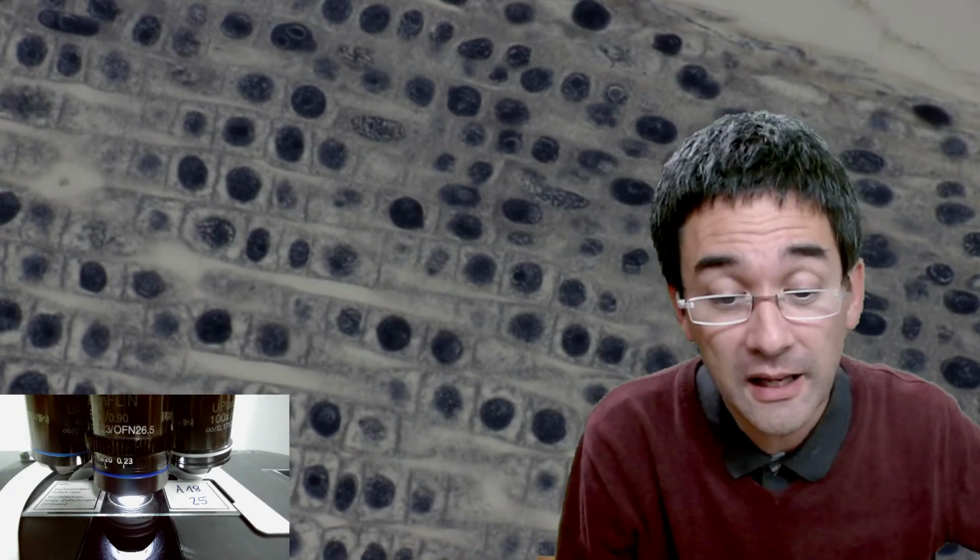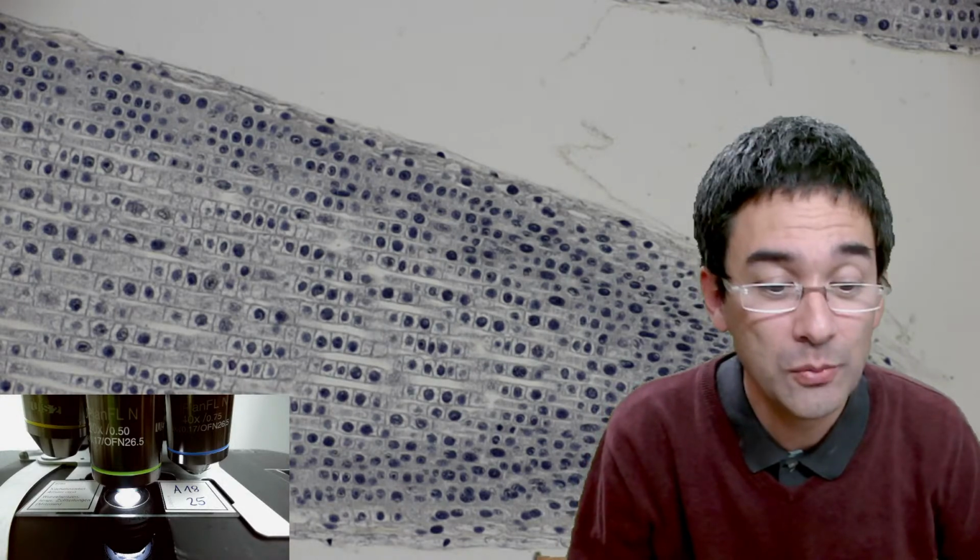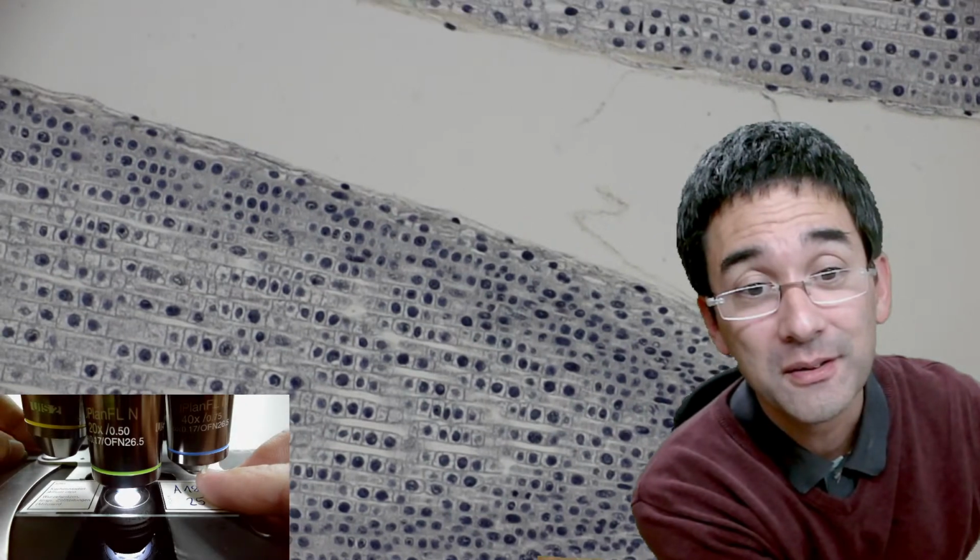What time is it? Oh, it's 43. You know what I want to do now, because I've been talking about this quite long now. I want to show you another slide where you do not see quite as many dividing cells, but the chromosomes are much nicer. That's the reason why I wanted to show it to you, because here with the onion cells, you've got to have a little bit of practice in order to see those. And the chromosomes are not quite as evident sometimes, but I like this one over here.